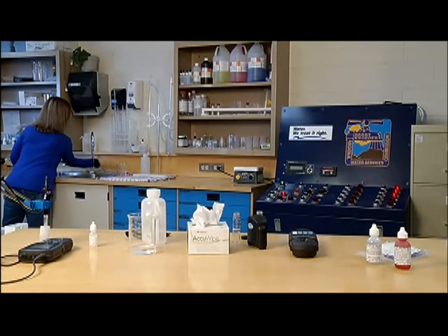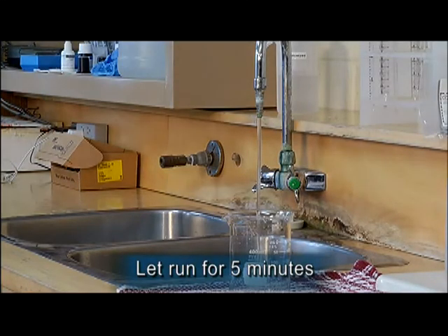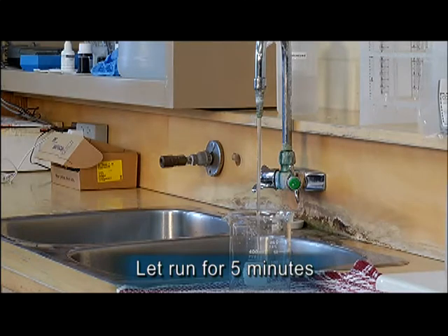In obtaining a representative grab sample for a manganese test, plan ahead and run the tap for the prescribed time of five minutes. Running the water is done so standing water clears the plumbing.